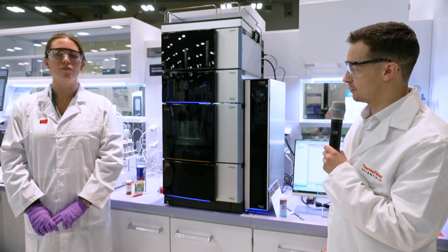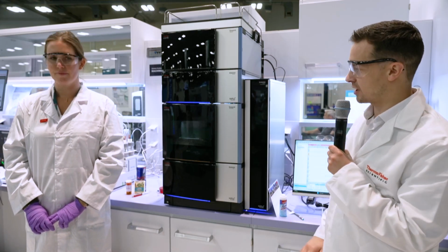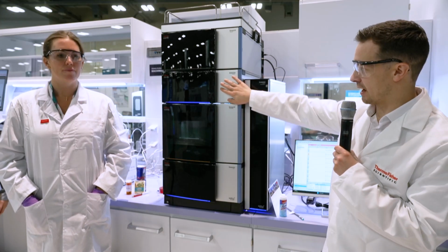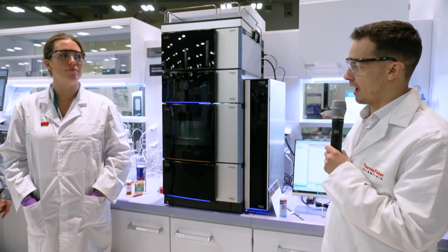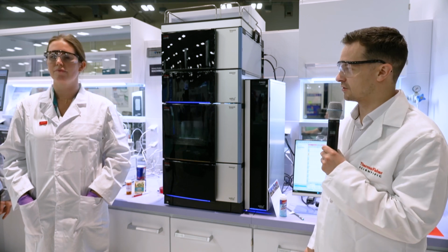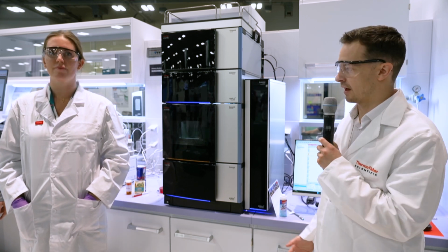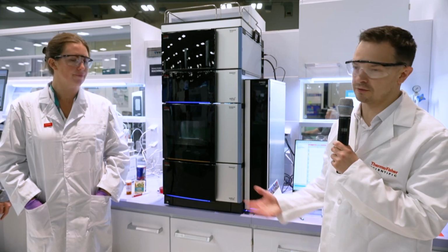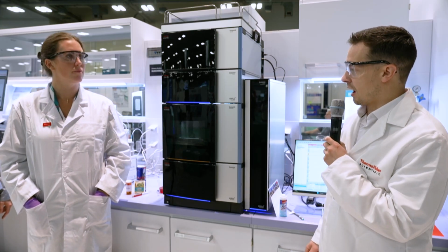And when it comes to liquid chromatography, generally speaking, most people associate that with UV detection, which we have here. That's because many compounds have chromophores, so UV detection is the perfect option for that. That's why probably around 80–90% of the market for LC is with UV detection.